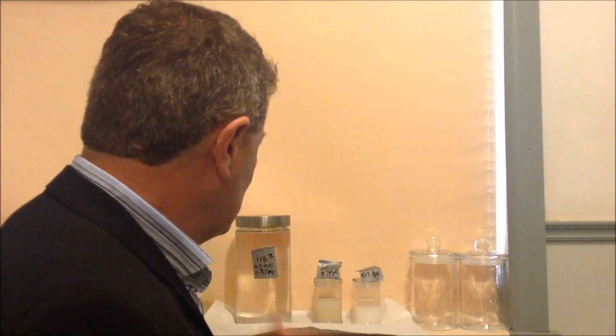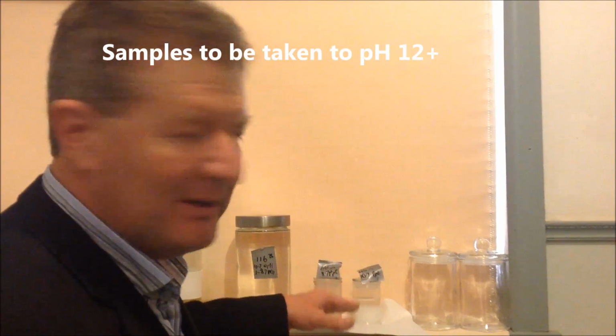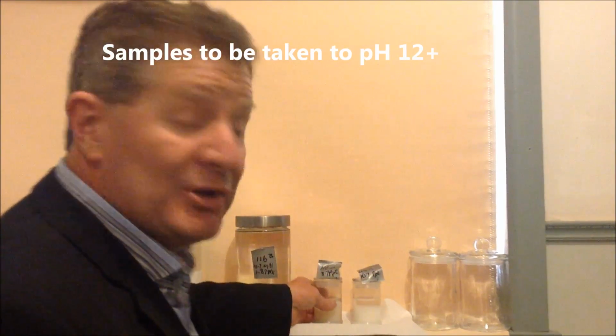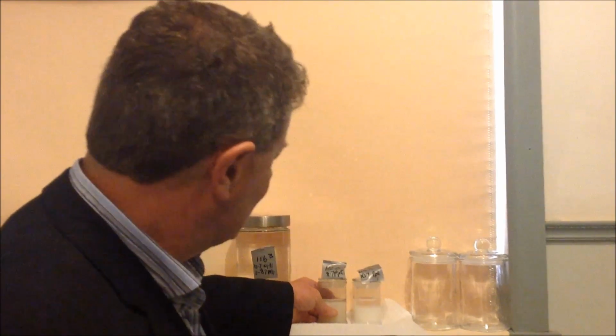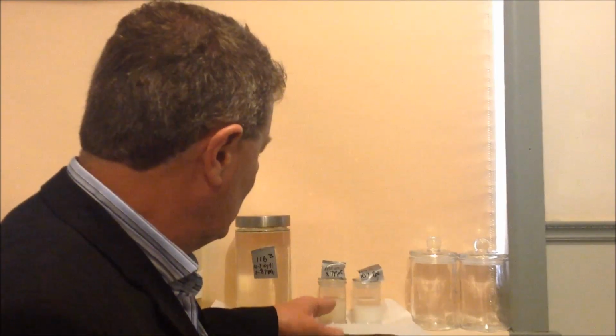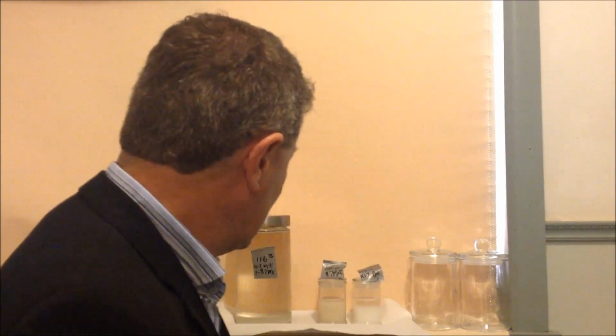Now the next stage will be to take both of these up to a pH of 12. This one's already at 10.7 of course, so it won't need to go as far, but who knows how much sodium hydroxide will be necessary to do that in each case. I will add a little bit extra water to that. Experience has shown me that you need to do that, otherwise you have trouble getting to that pH, something to do with the buffering. So apart from that, adding a little bit more water, it may end up being in a different container because the volumes will change.